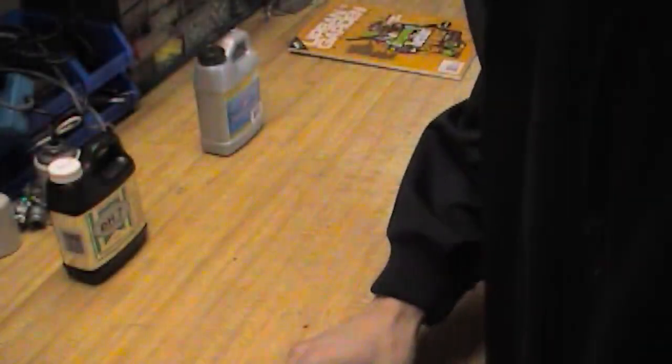Hello folks, Hydro Guy here. As a grow store guy, one of the things I'm asked about more often than not is to show people how to calibrate their pH pen. It's not the most complicated thing in the world.